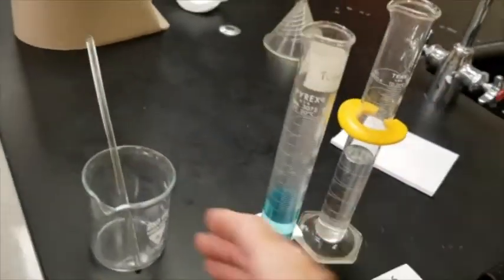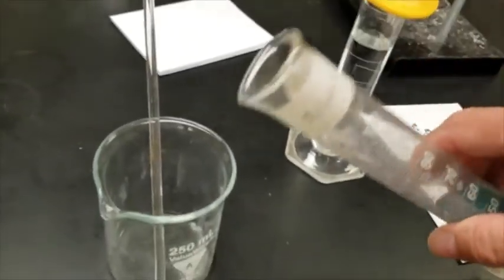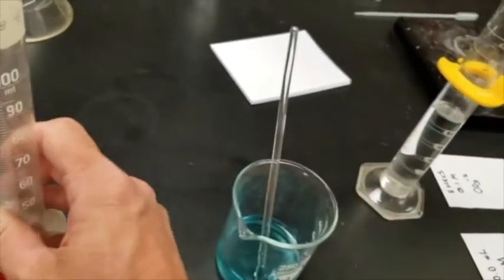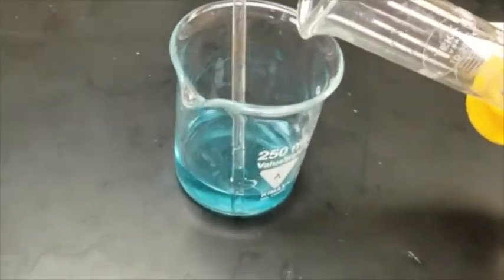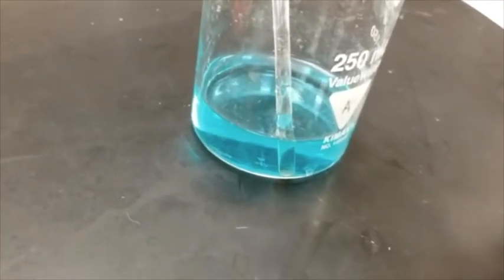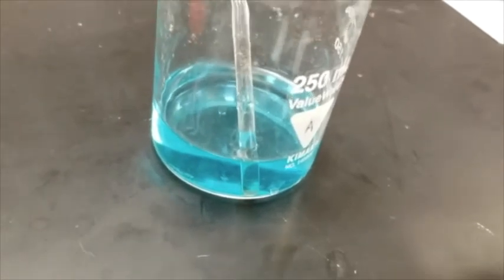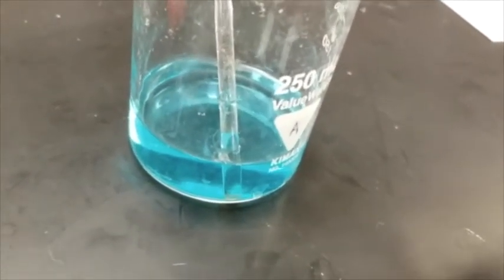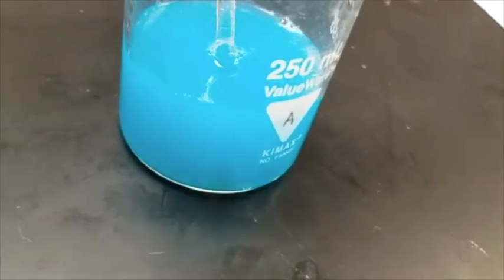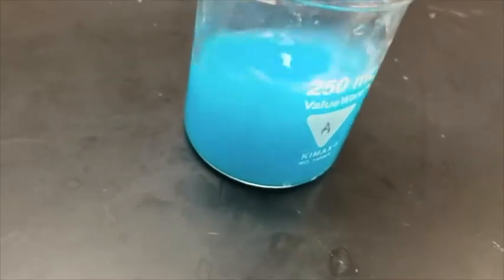So now all you have to do is take each of these guys and react them. So I'm going to go ahead and pour him into a beaker, and I'm going to pour him into a beaker, and watch what happens, because again, take a moment and predict what this is going to look like when it's done. You're creating an insoluble precipitate with this, and so what's it going to look like? So here I go. Watch what there. Oh, look at that. It turned cloudy. And now I'm going to give that guy a stir, stir, stir, stir, stir.